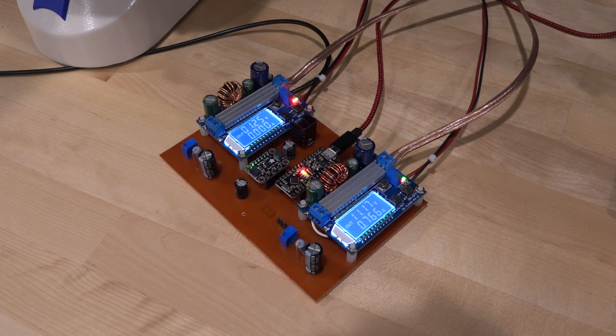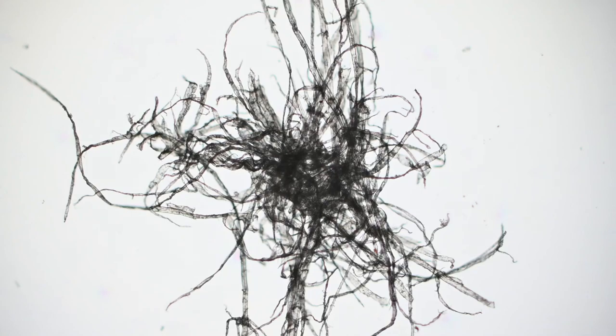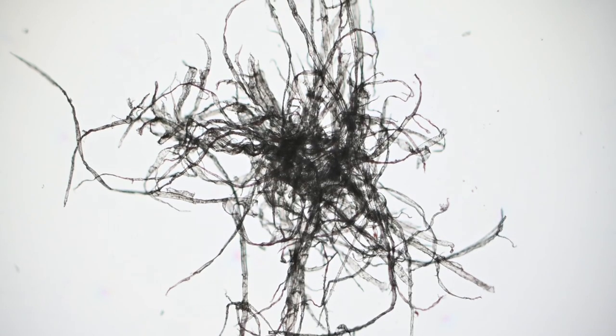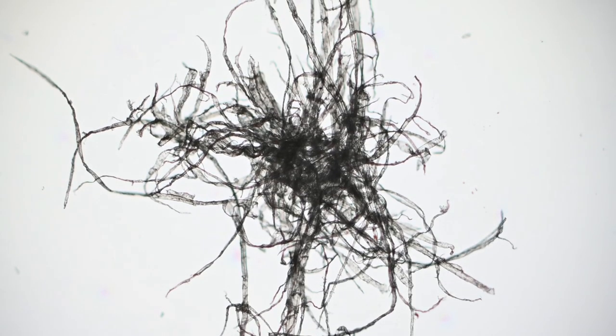So now that it all works, let's look at some samples. So what we're looking at here is a tiny piece of a napkin. So these are the fibers inside the napkin looking at it at a 50 times magnification. So this is a transmission type microscopy where the light is going through the sample, so the illumination is from the bottom.